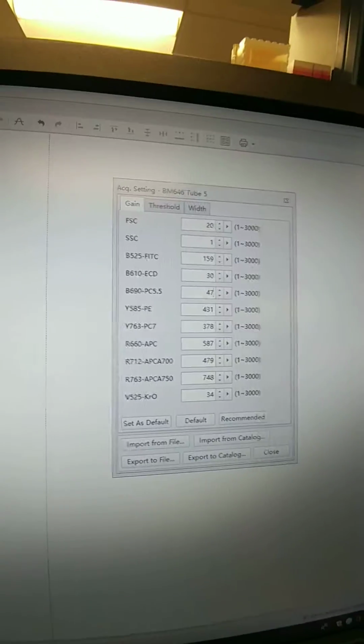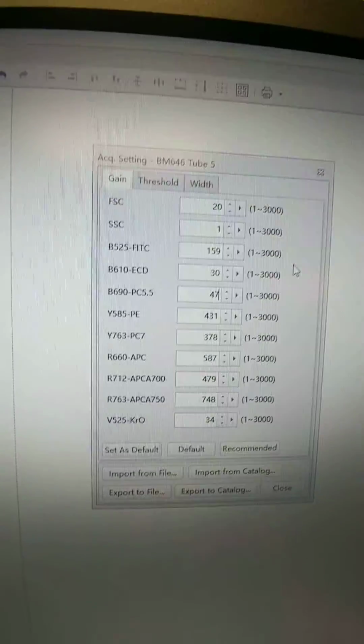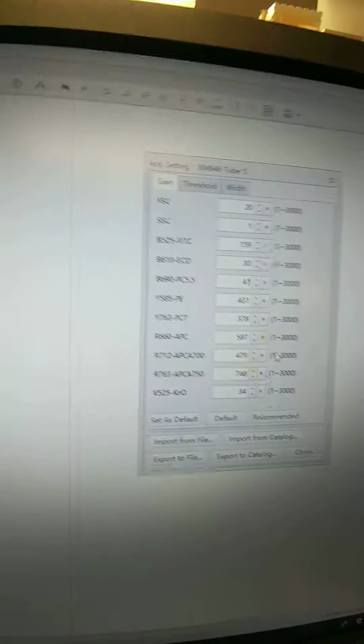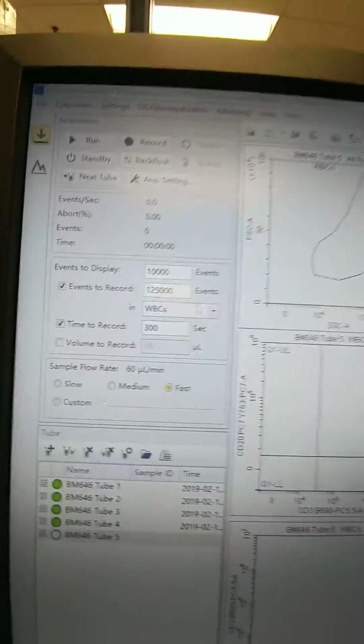Okay, you also can change these manually with the gain hand while it's running. But that can get a little messy. I'm just going to show you this way too if you don't like using the hand and you want a more precise changing by numeric. So we can leave this window open while we're running the sample. Okay, and so now we're ready. I'm going to just double check here, 125,000 events.